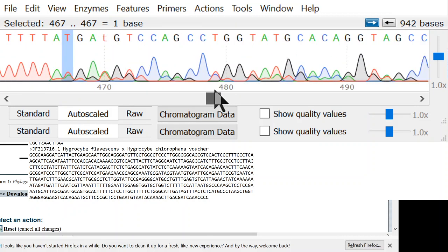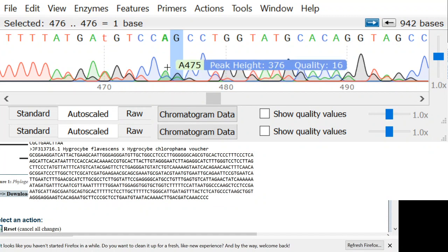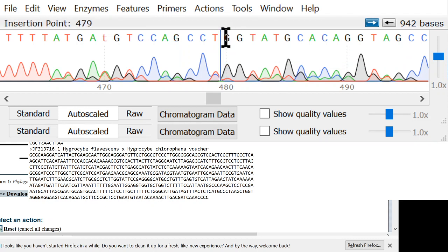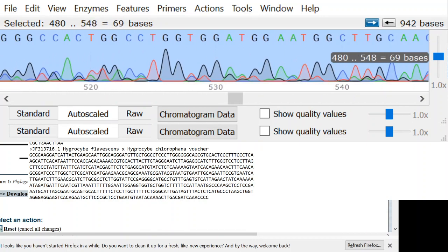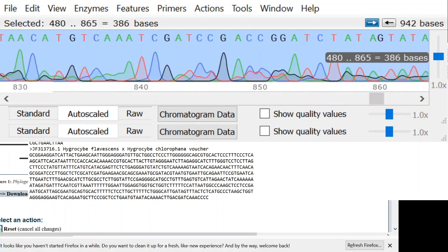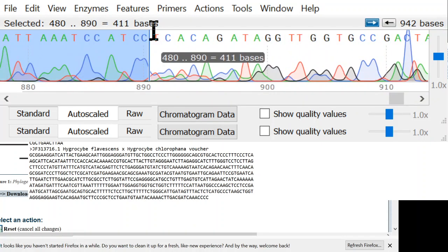So I can go through really slowly and clean up. Here we have an A and the G in exactly the same spot, but I know that the A was a slippage from this, so this one's good. I can go through here and I can clean up this problem, but that's a lot of work to go through here and clean up, and maybe it's not even worth doing because very often you make mistakes here and you got to correct the mistakes later in BLAST, and it's really time consuming. So you can see this enzyme slippage problem just continues off until the end of the sequence.